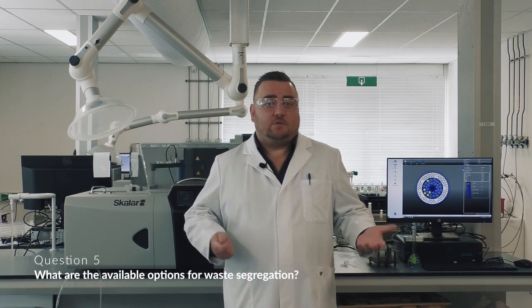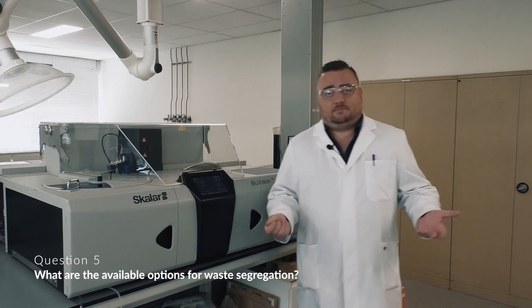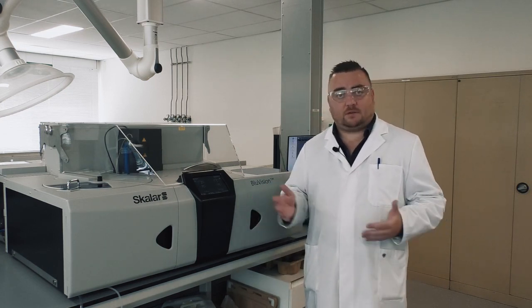What are the options for being able to segregate waste? So basically, of course, safety first. The safety of operators of the instrument is of paramount importance. So being able to separate waste based on whether that's acids and bases or acids coming into contact with any, say, liberatable cyanide compounds.